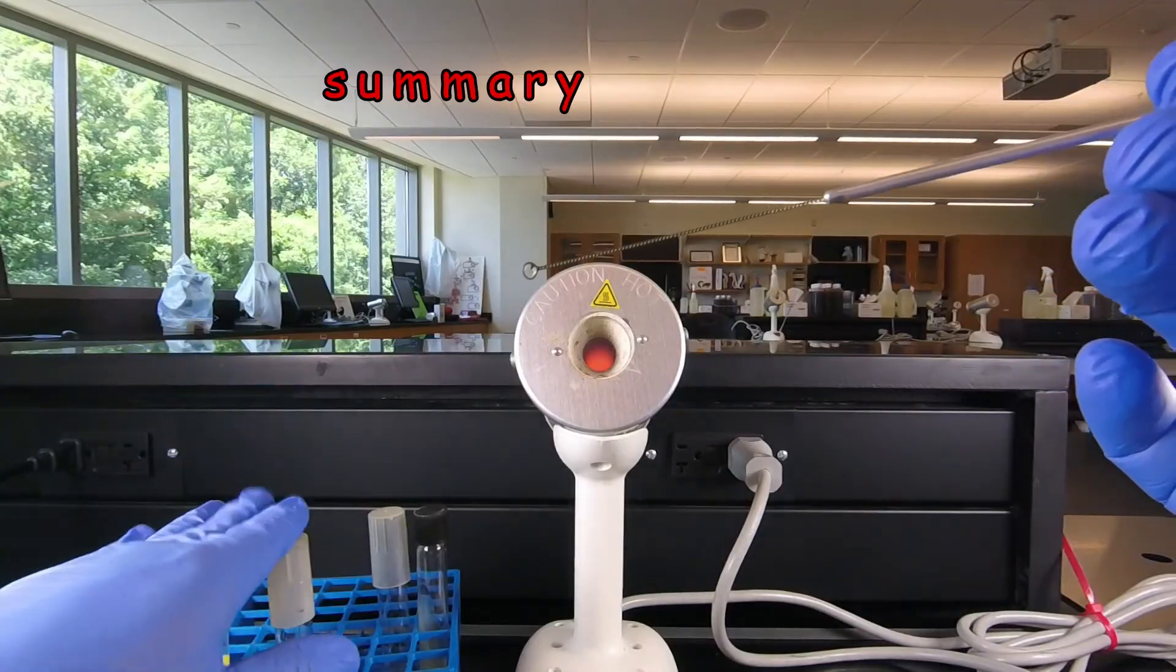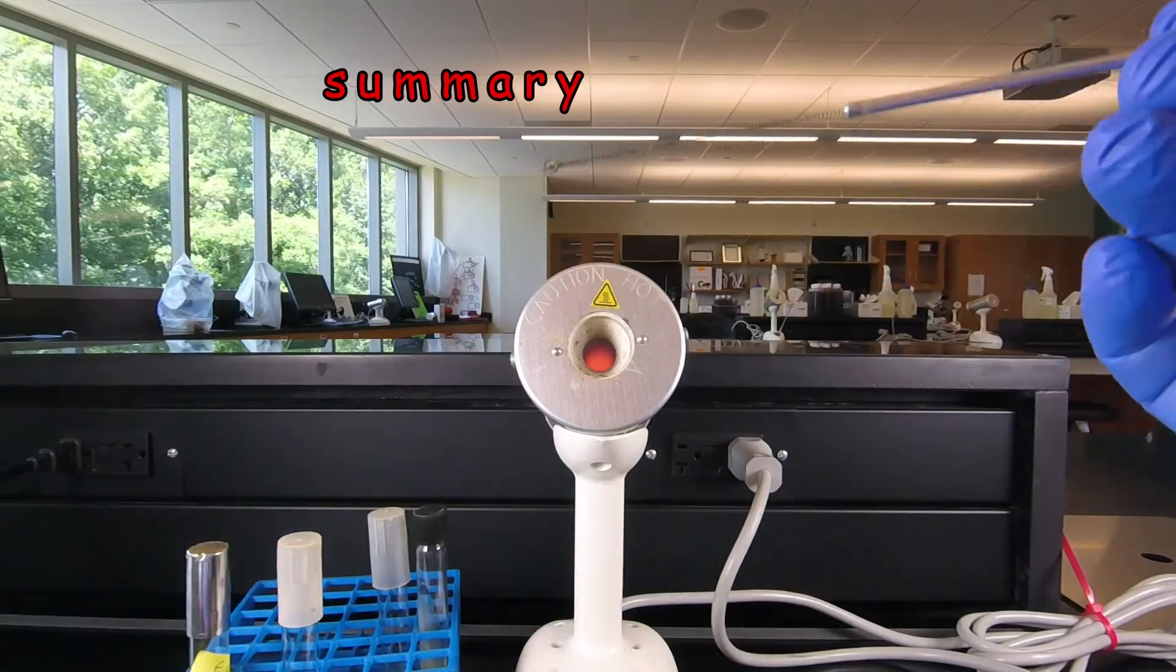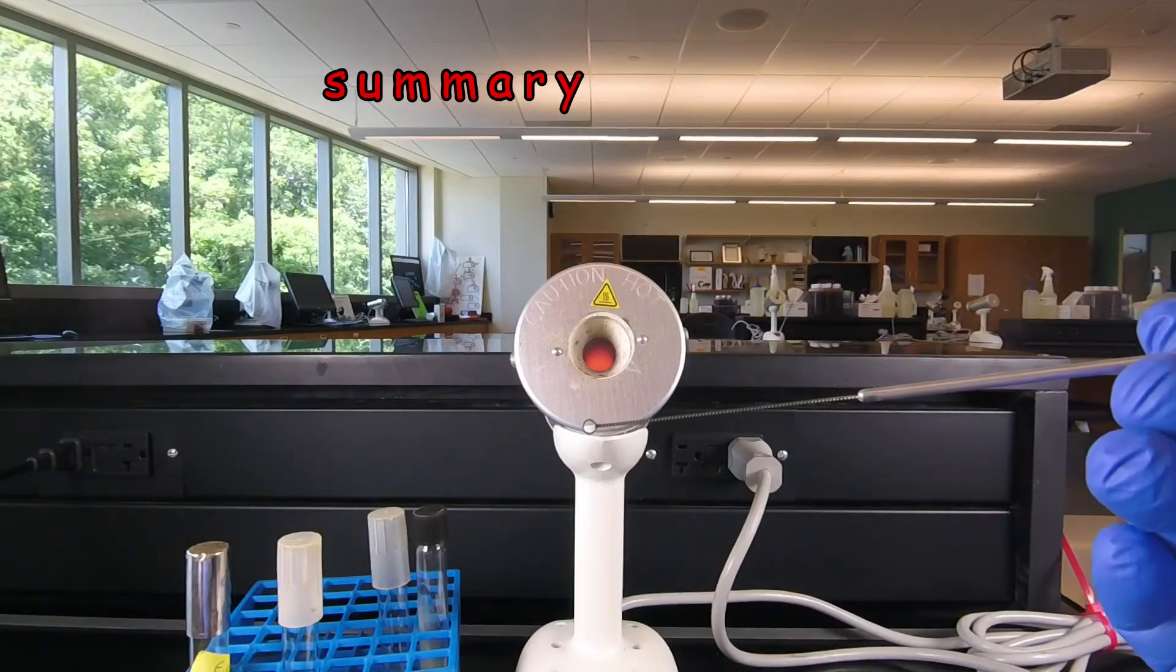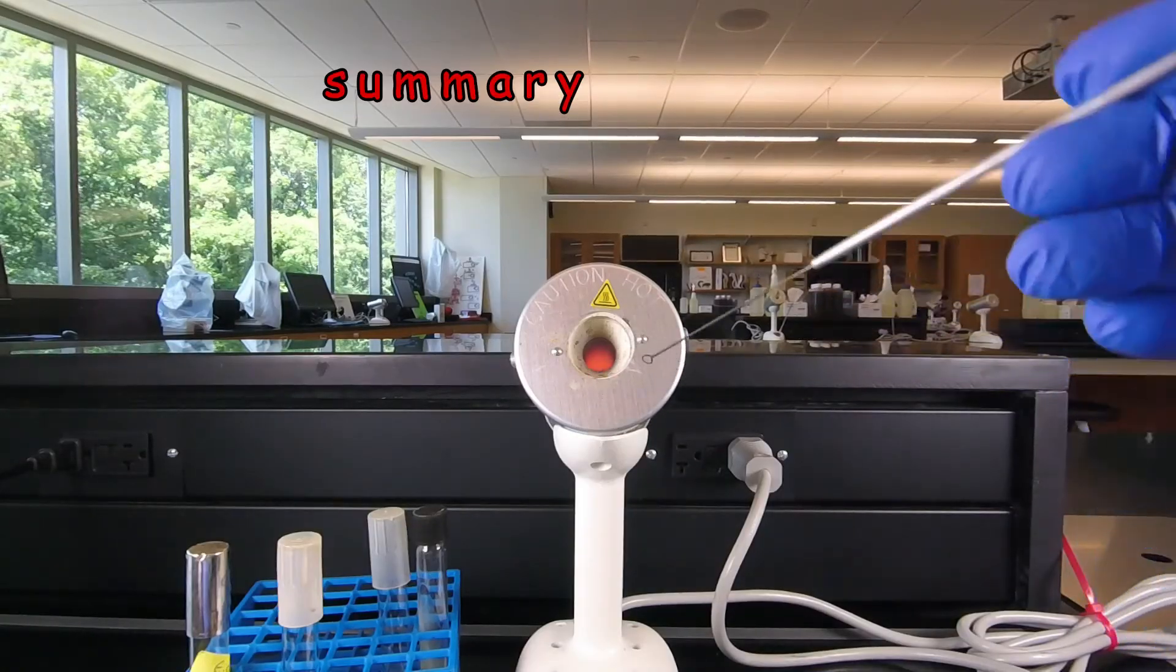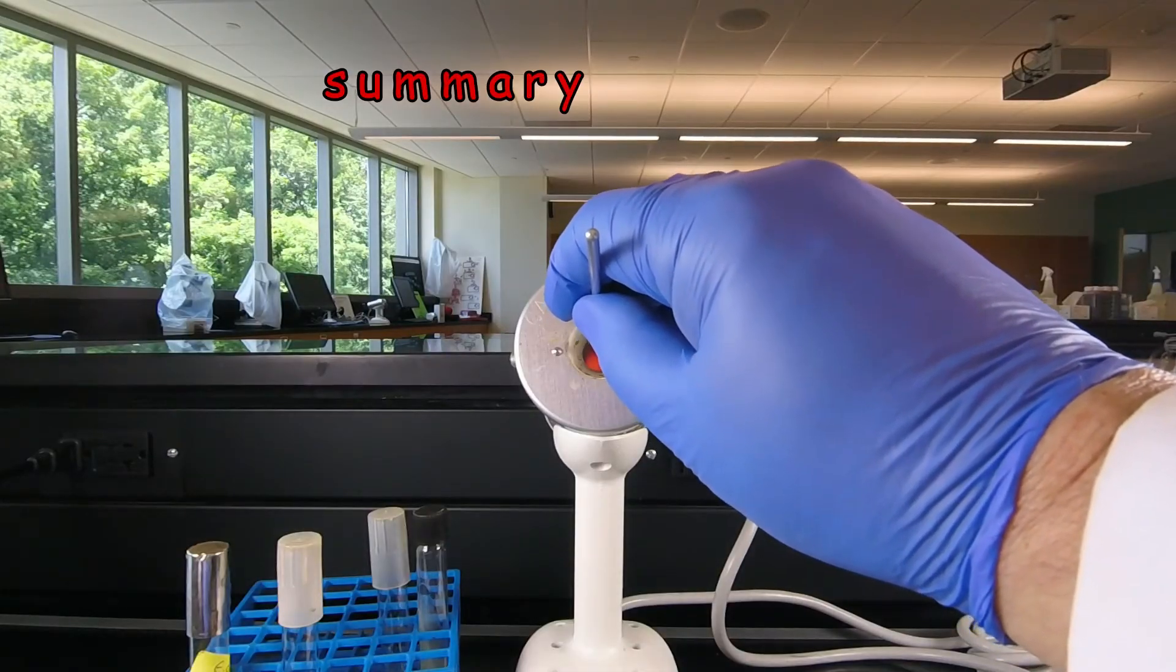So notice the tube is only open long enough to get the bacteria out and to put the bacteria in. And of course when we're all done there's still lots of bacteria on our loop. We're going to stick that back in the Bacto incinerator for 10 seconds to sterilize the loop again.